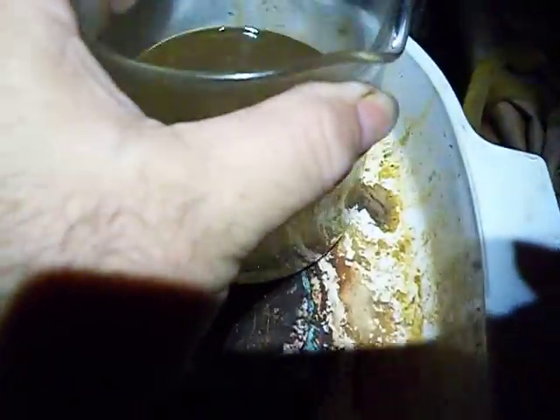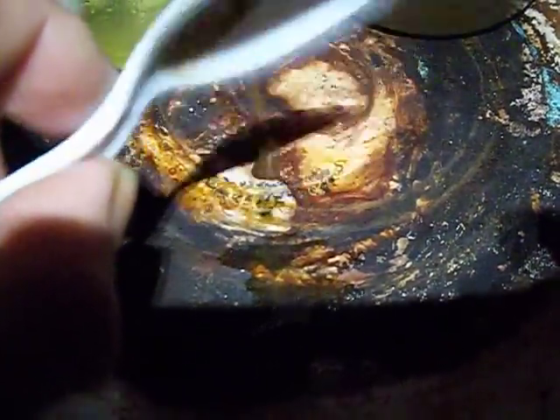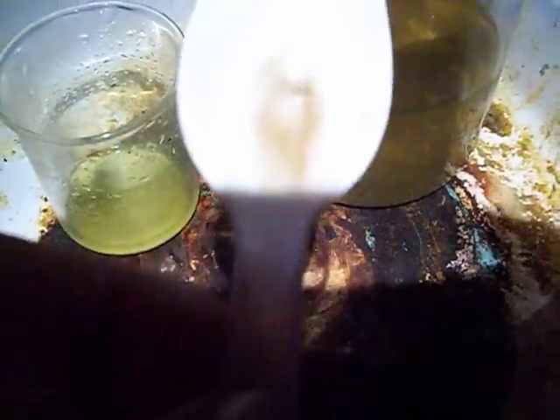The gold's moving around and they're pretty good. I know it's still got a lot of palladium in it because that was the first test I did with stannous chloride — the black part is the gold — and then after the drop, that's the stannous test after the drop. So the stain is green and a little bit red.